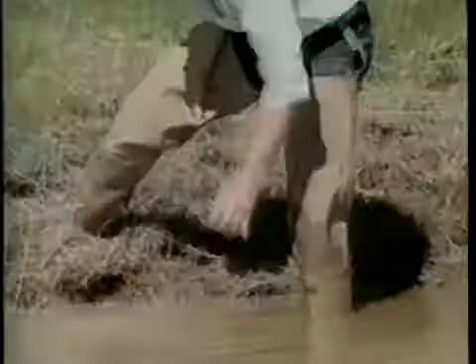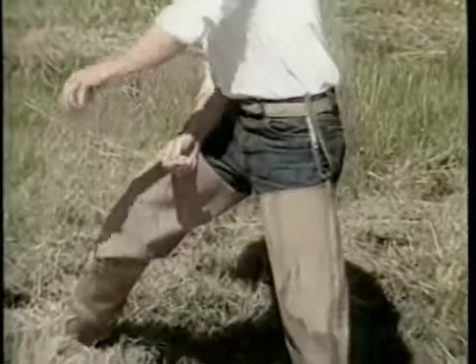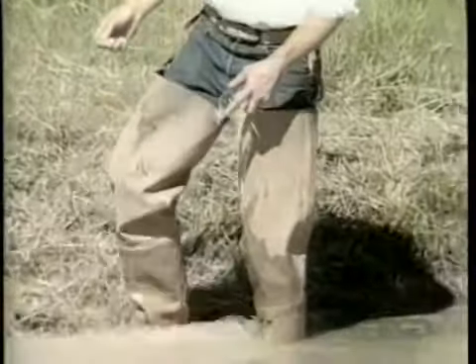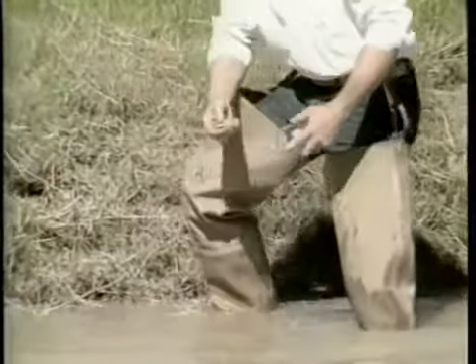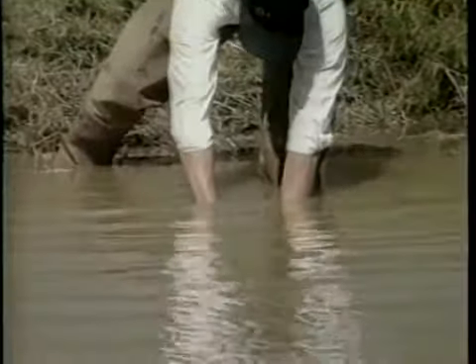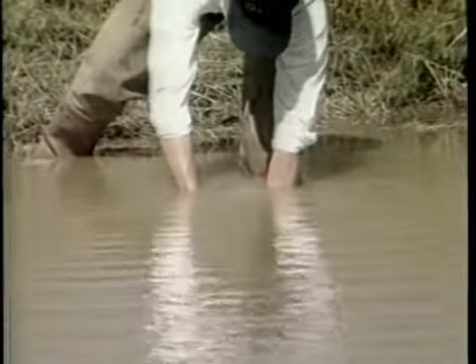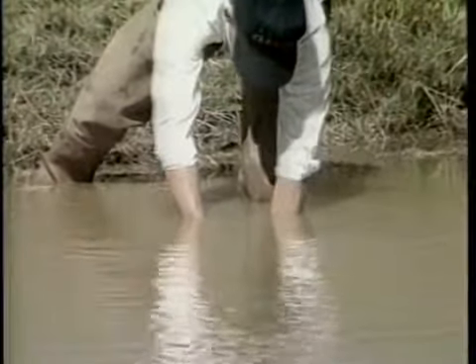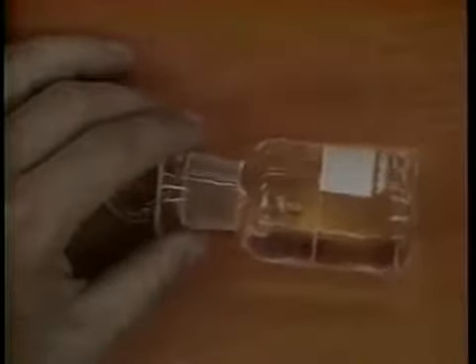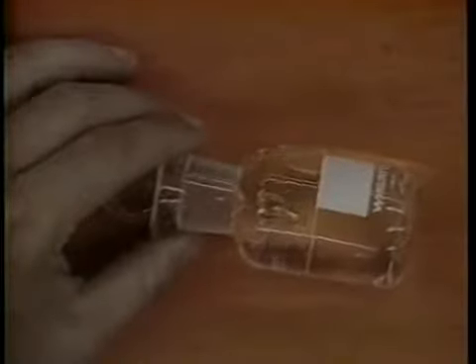The sample should be taken away from the pond bank to avoid vegetation. Sample away from aerators and inflowing water, and preferably with the wind at your back. This will usually give you the lowest reading in the pond. To take the sample, submerge the bottle approximately 1 foot below the surface. Unstopper to collect the sample, and then re-stopper the bottle under the water to ensure that no air bubbles are trapped. It is important that no air bubbles are present, since they will increase the dissolved oxygen value by dispersing the oxygen from the trapped bubbles into the water sample.